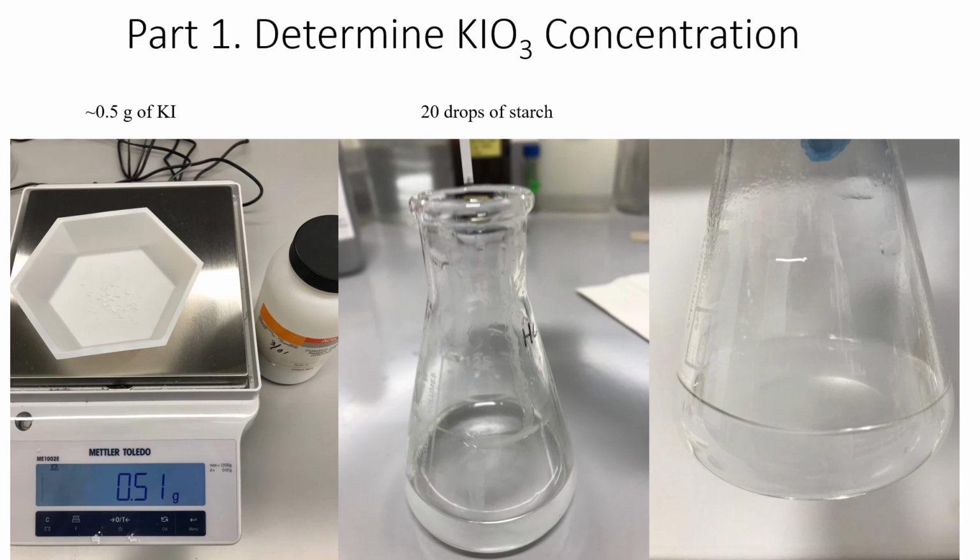So after I measured out about 0.5 gram of this potassium iodide, I add this solid into this ascorbic acid containing the hydrochloric acid. This solid dissolves right away, because it's a potassium salt, and all the potassium salts can dissolve in water. Then I add about 20 drops of this starch solution.